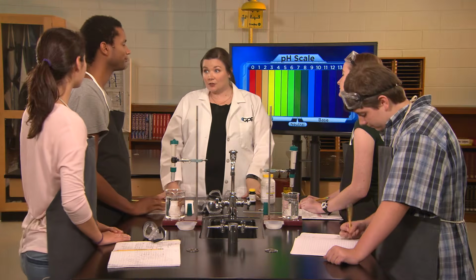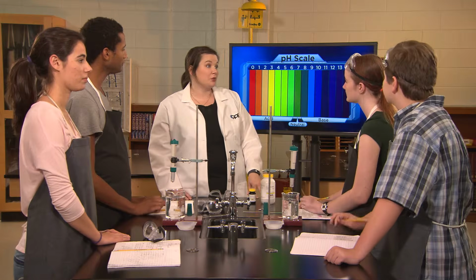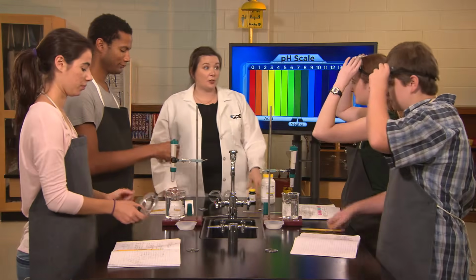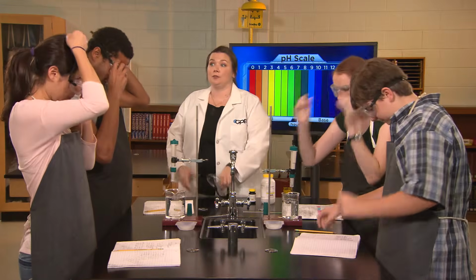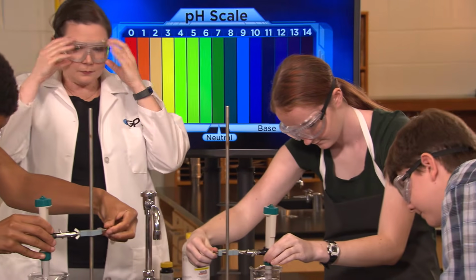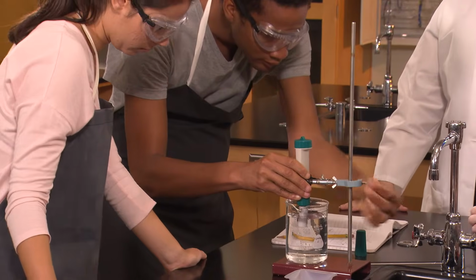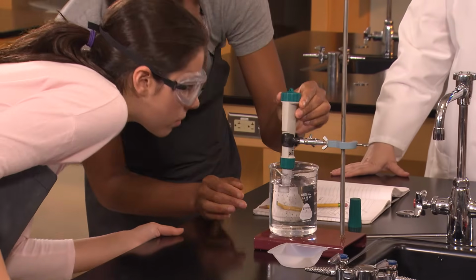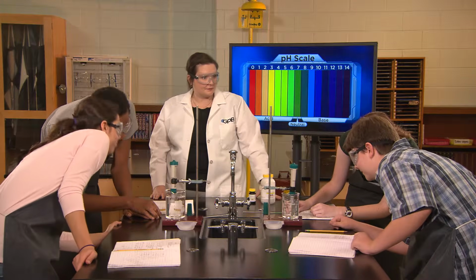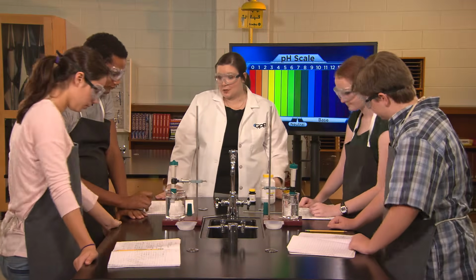Rachel and Aaron, I've given you guys a sample of zinc nitrate. And Kat and Cade, you two have a sample of aluminum nitrate. With your safety glasses on, place the pH meter into the water and measure the pH. Our water has a pH of 7. That's what I expected. Us too. Now add your metals and watch the pH meter.